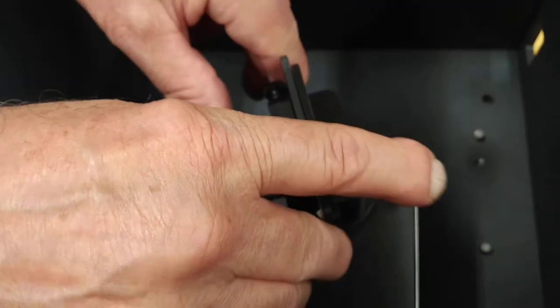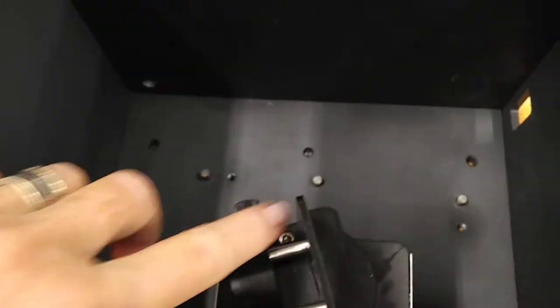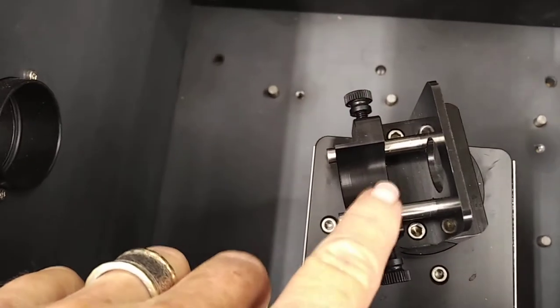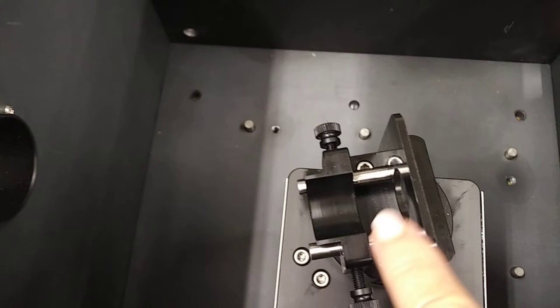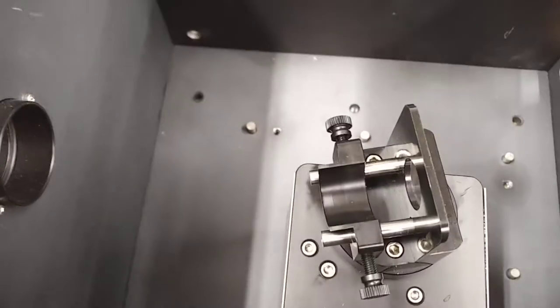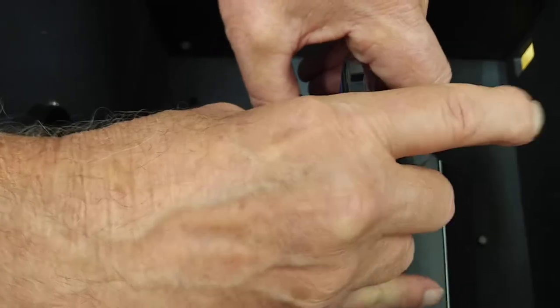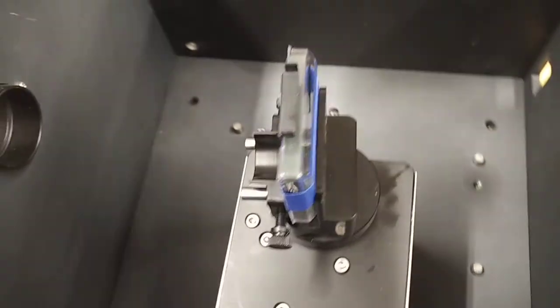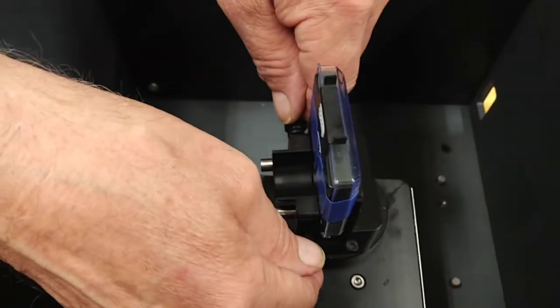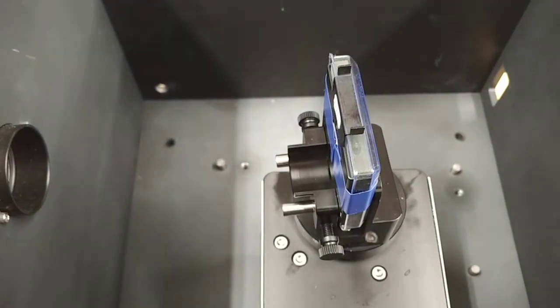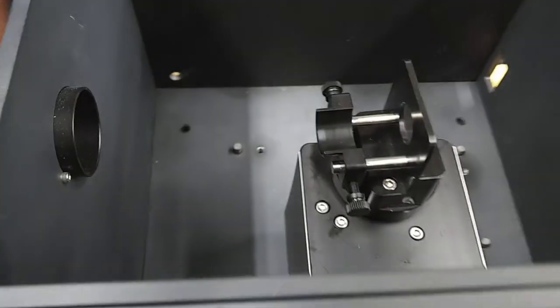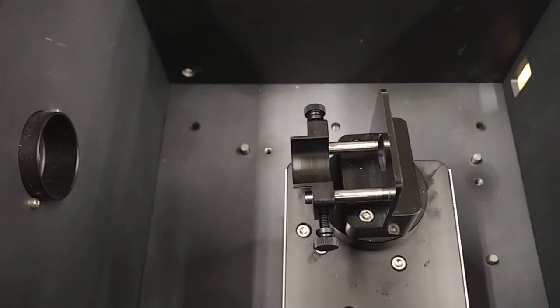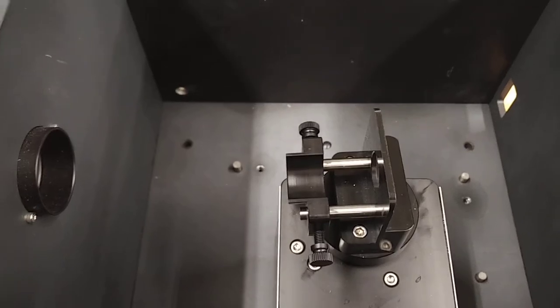All right Rich, thank you. What you're doing is you're simply sliding away this mechanism here in order to adjust the thickness of this space. Yes, you're simply just pushing it with your thumbs. Here we have a larger piece. It can be locked in place with these.